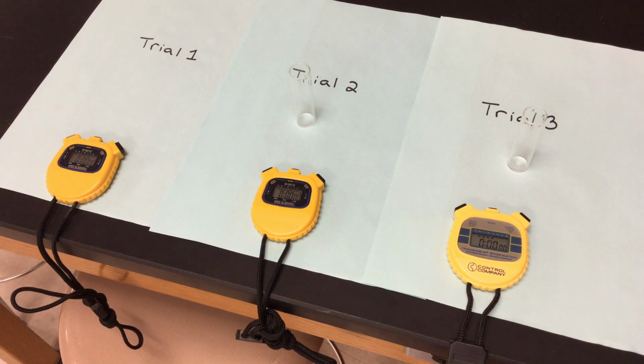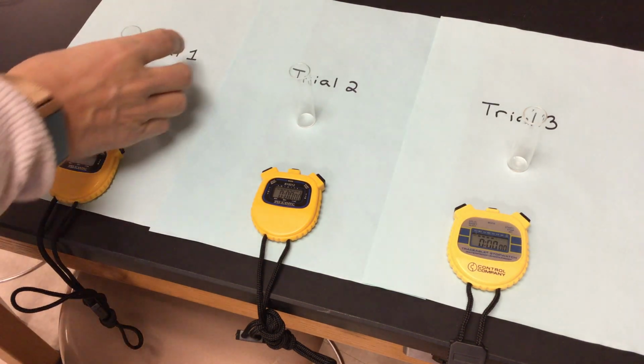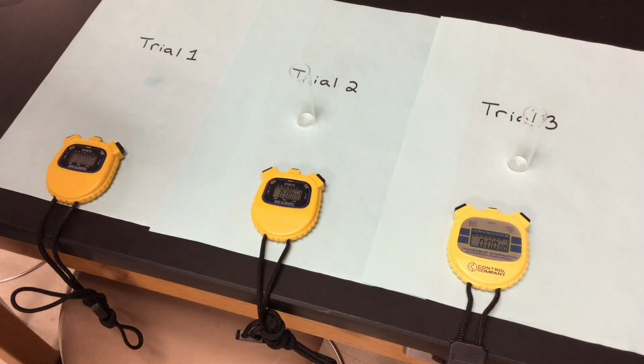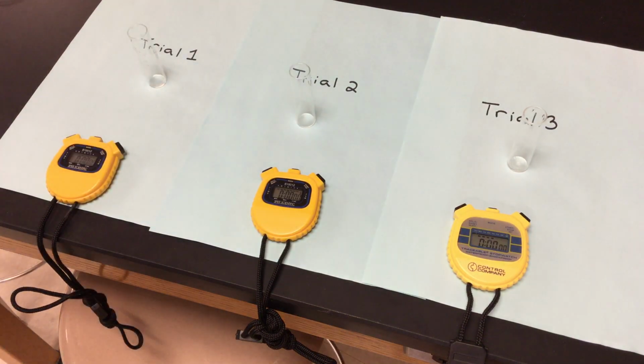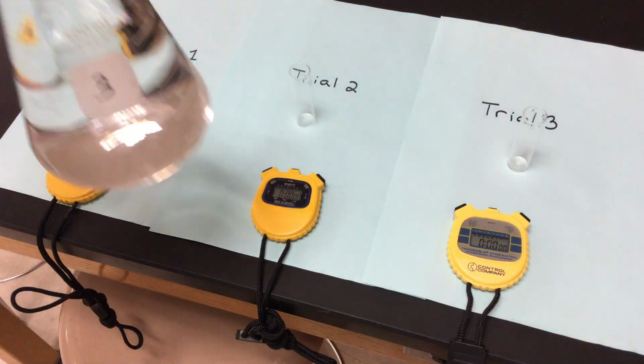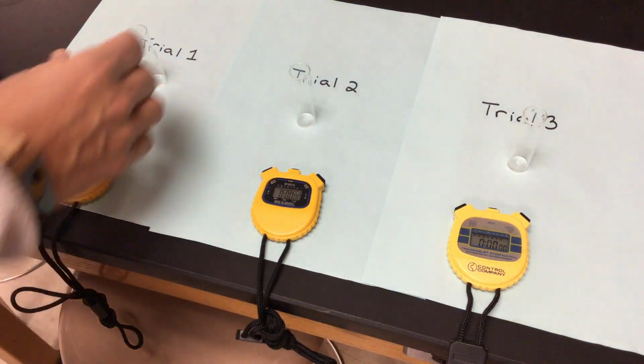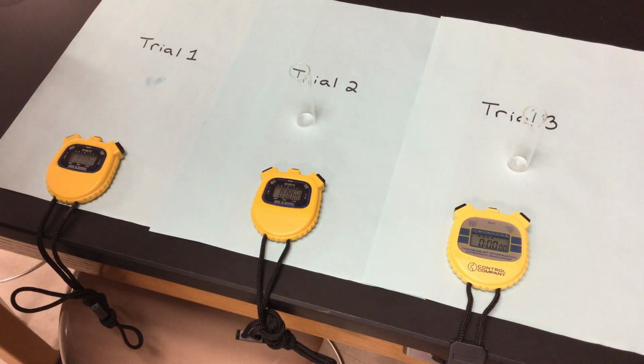And I'm going to start with pH of 3. Okay, so we are doing our pH right now. I want to make sure everything is out of that little vial that I have. So we're cleaning it out, putting it in my waste container. And there are my 3 vials right there. So I'm going to take my solution of pH of 3. So it's got some acid in there. It's also got some hydrogen peroxide that the catalase should be able to work upon from my yeast.